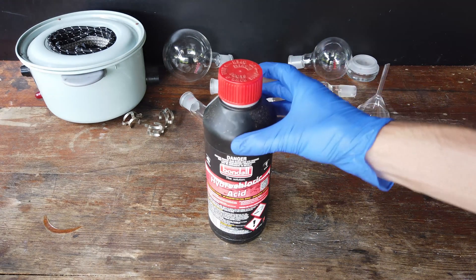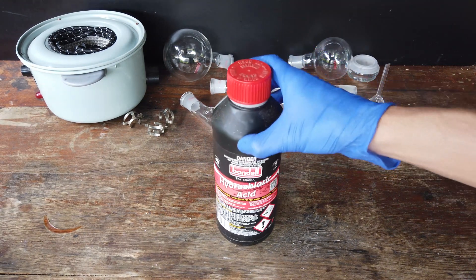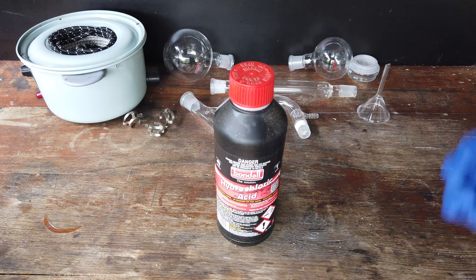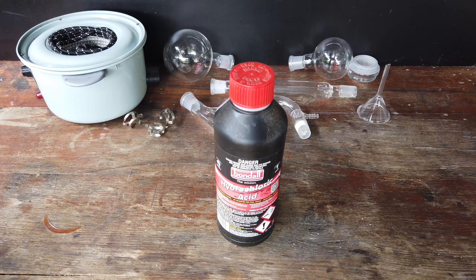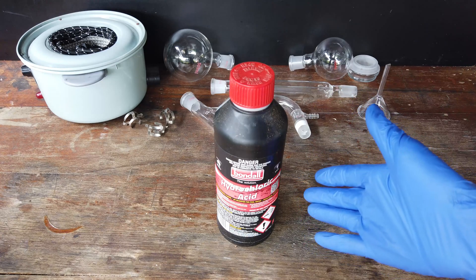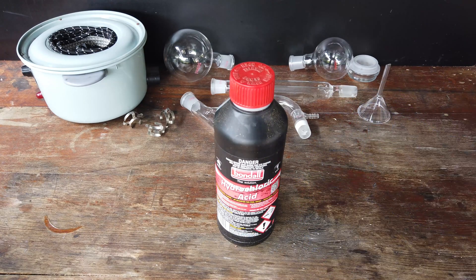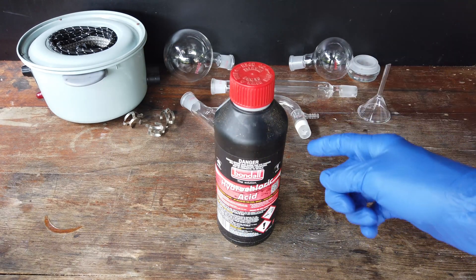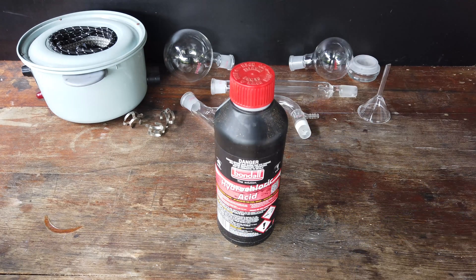Luckily for us, there is one very easy method to purify this impure hydrochloric acid, and that is distillation. So that's what we're going to be doing today. We'll distill some hydrochloric acid to purify it and save it for later use when we don't want to have any contamination at all.